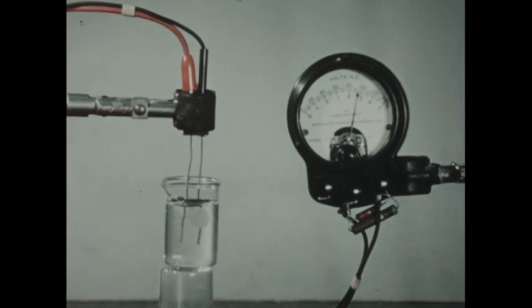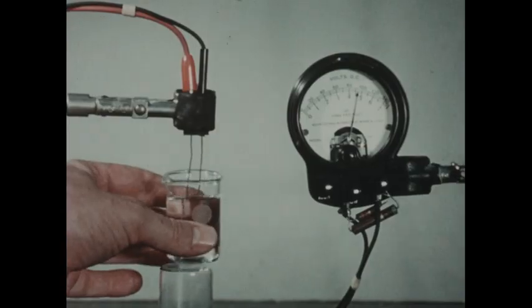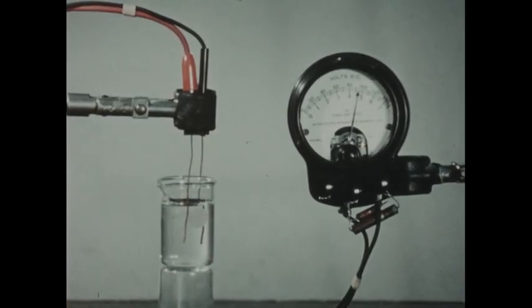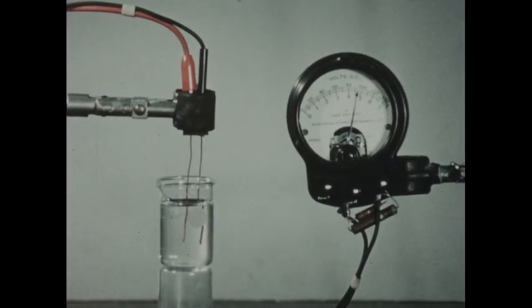And you'll observe that the addition of the non-conducting distilled water to the solution of phosphoric acid and alcohol has resulted in a mixture which conducts the current very well. In fact, the original conductivity of this solution was probably due to traces of moisture which dissolved in the alcohol from the air in the room.